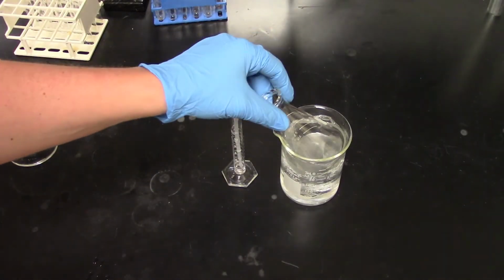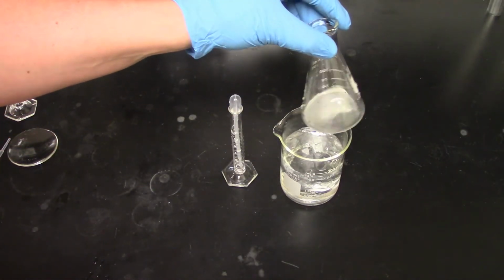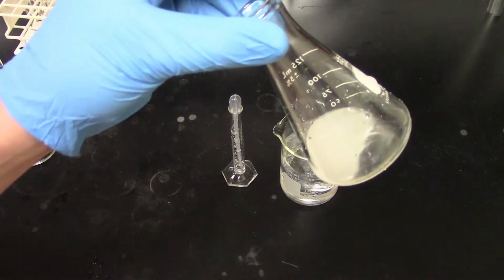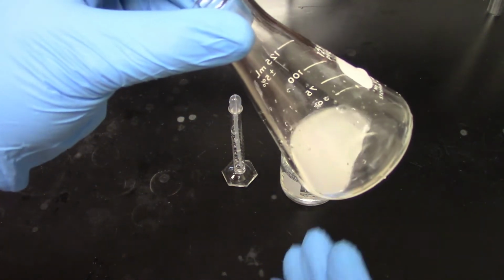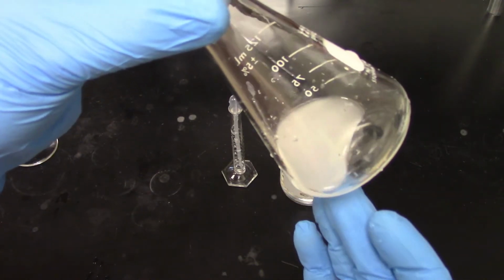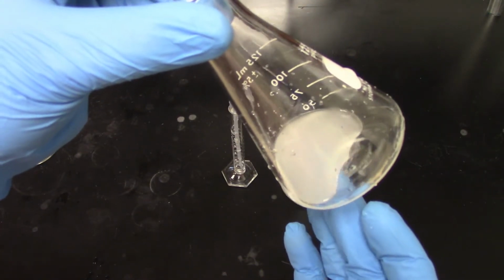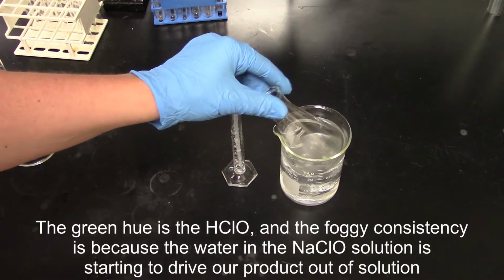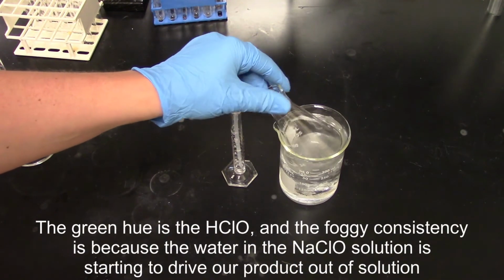Okay, so here we are at about the 3-minute mark, and I'm going to pull out a solution. Usually you keep this in the ice bath, but we want you to be able to see what's going on here. We've added a lot of the sodium hypochlorite at this point. That color you're seeing now is a blend of both the hypochlorous acid forming as well as our material reacting with the hypochlorous acid.